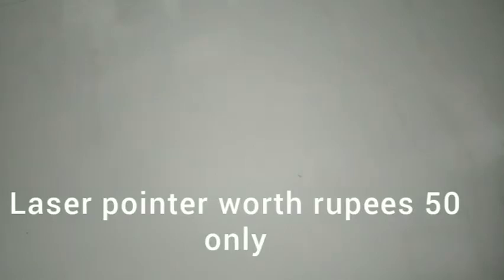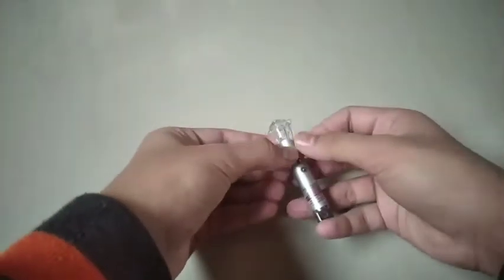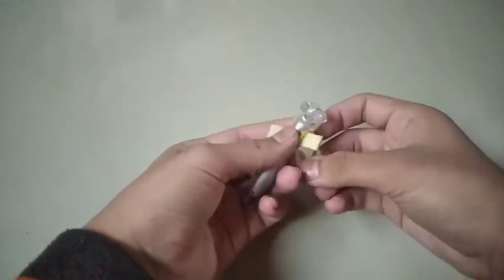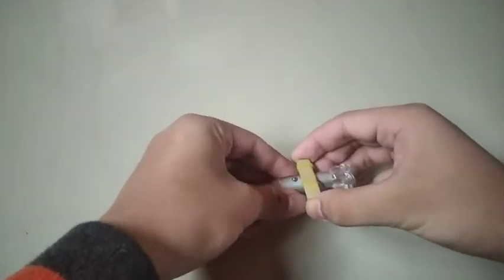For this laser pointer, we need to continuously press the button. To fix this, I'm using a combination of ice cream sticks and rubber bands. Now it can be turned on for a long time.